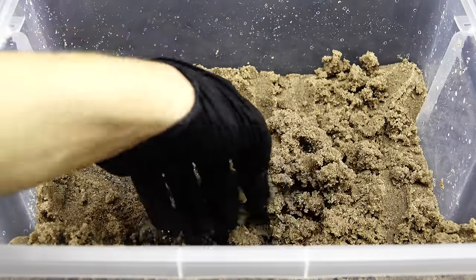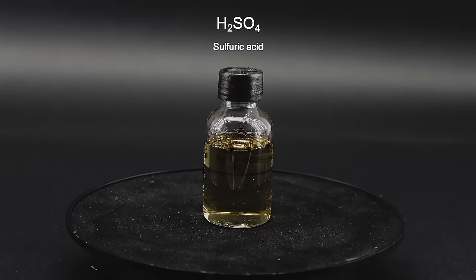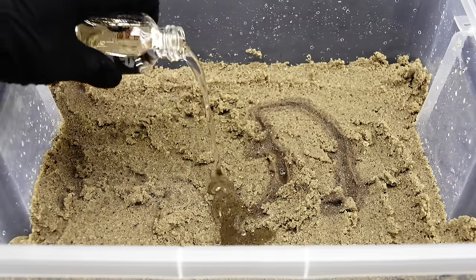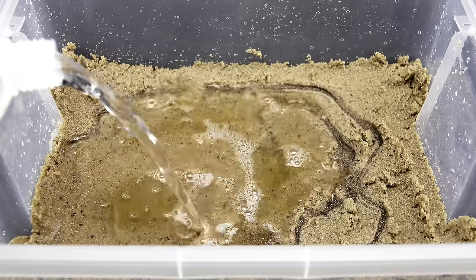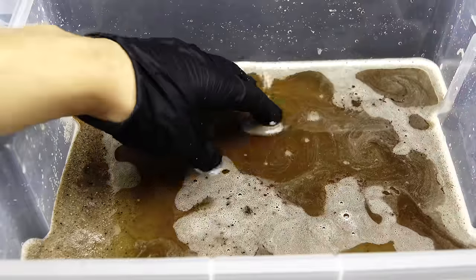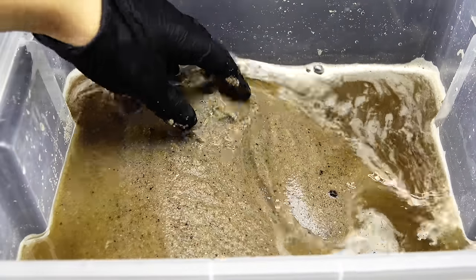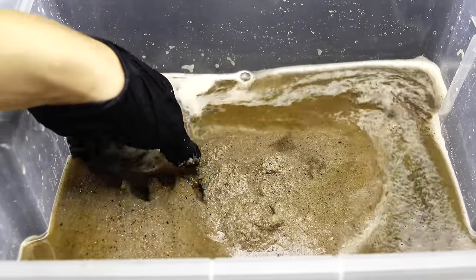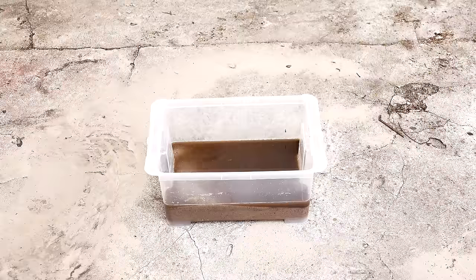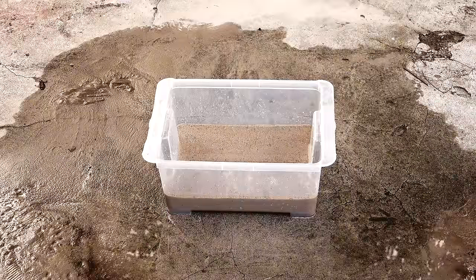It was decently pure, but since I want my future silicon to be as pure as possible, I had to perform one last cleaning step, and that is to wash it with some acid. The acid should destroy everything except the silicon dioxide, purifying it, and my acid of choice was some 98% sulfuric acid, which I have a ton of made from a car battery. However, hydrochloric acid could also be used here and it would work just as well. I added 50ml of this sulfuric acid onto the sand and diluted everything down with some distilled water. I then swirled this mixture around to evenly distribute the acid, and left it to marinate overnight. When I came back, the water had visibly gotten dirty, which was a really good sign of the acid doing its job.